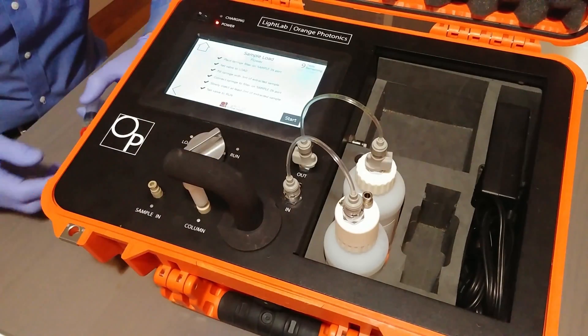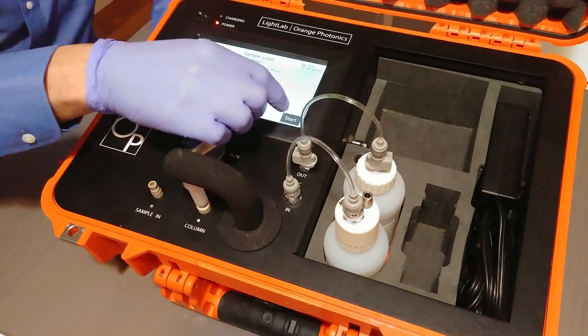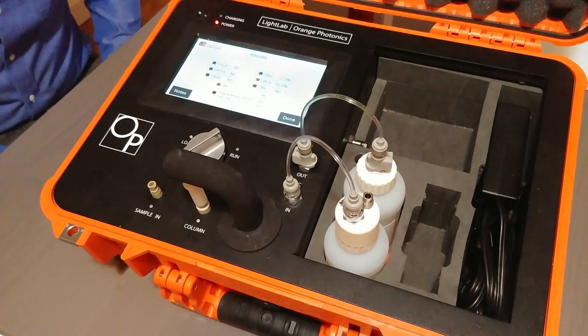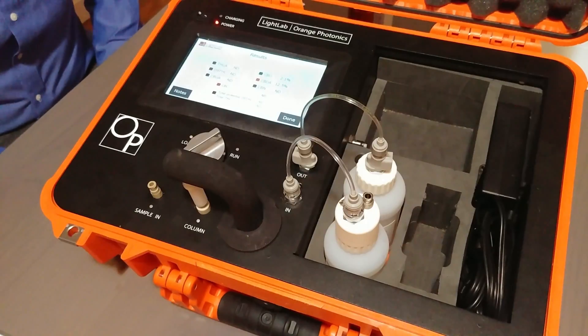And finally a start button is pressed to begin the analysis. After eight minutes the results will be displayed on the screen.